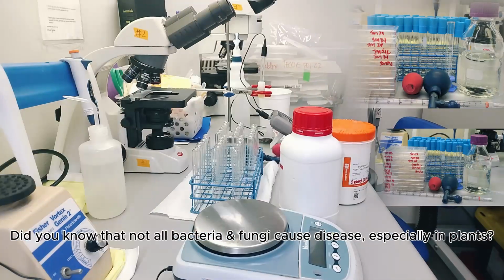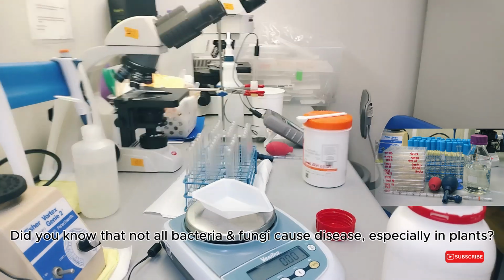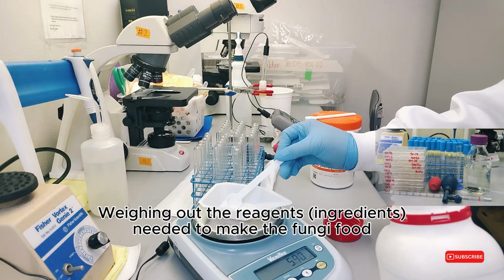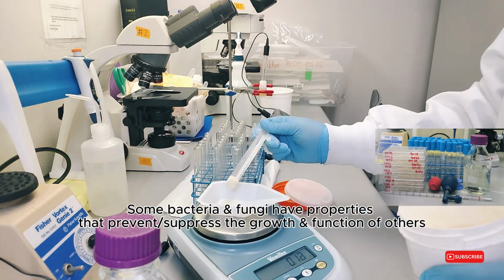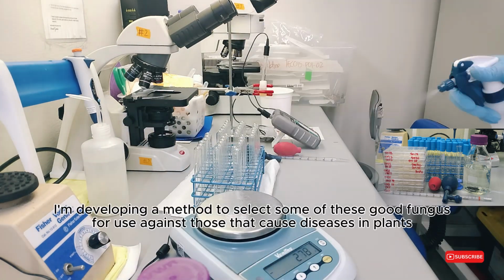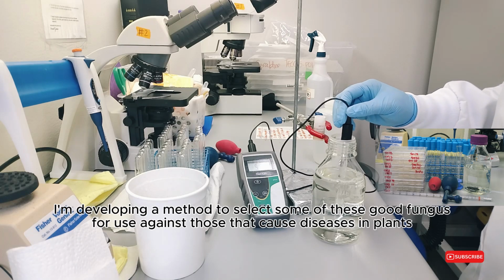Did you know that not all bacteria and fungi cause disease, especially in plants? Weighing out the reagents, the ingredients needed to make the fungi food. Some bacteria and fungi have properties that prevent or suppress the growth and function of others. I'm developing a method to select some of these good fungi for use against those that cause diseases in plants.